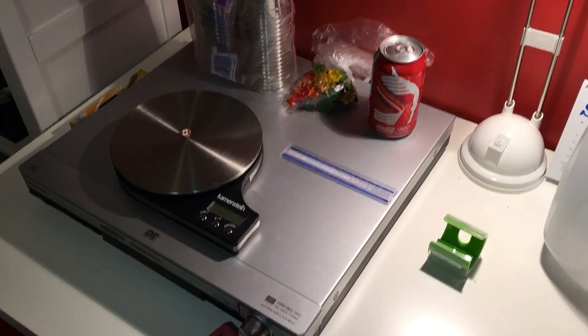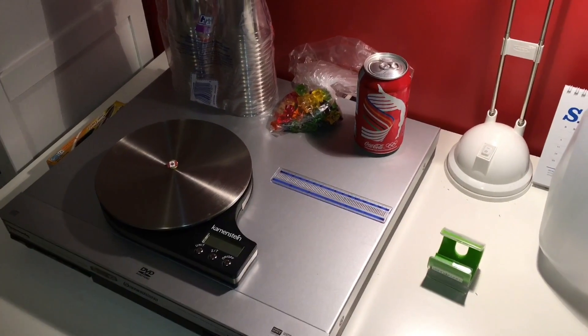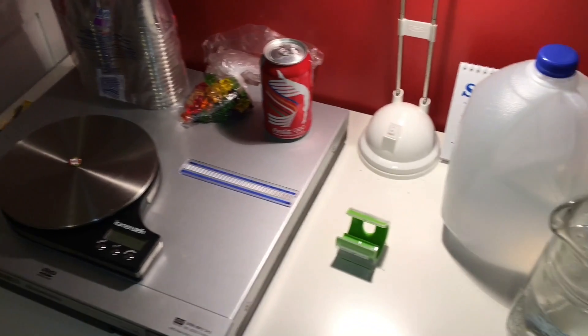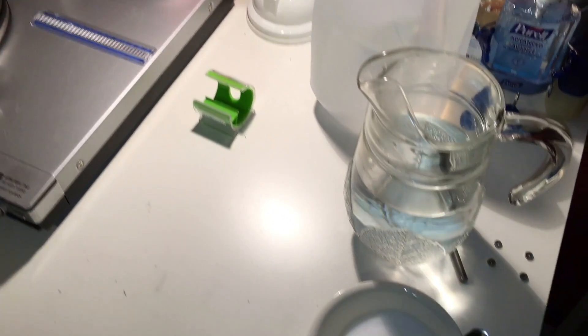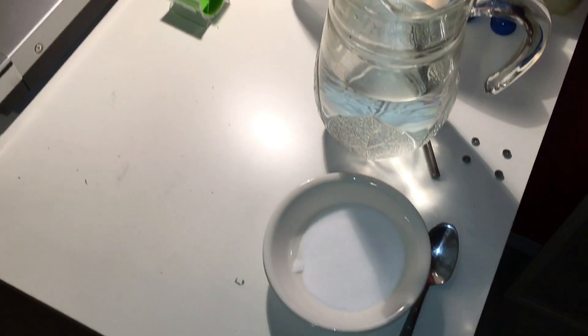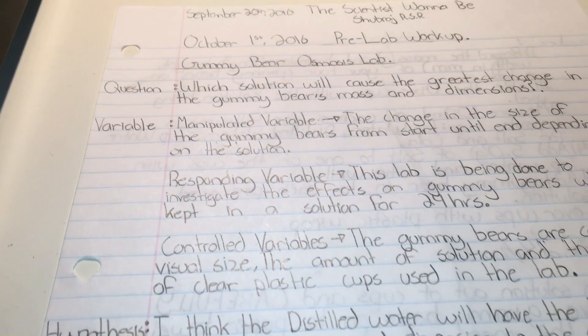Today we will be doing a lab called the Gummy Bear Osmosis Lab. This lab is quite commonly done in a grade 10 biology classroom. This right here is my formal lab write-up sheet.